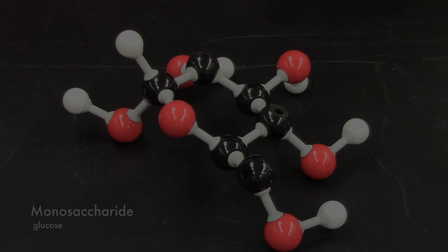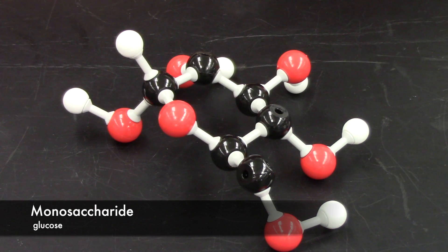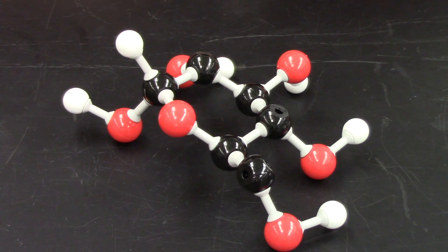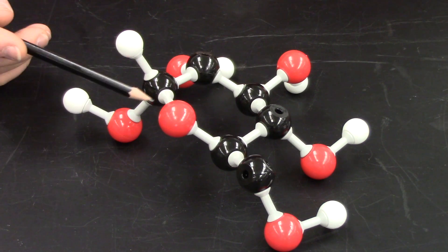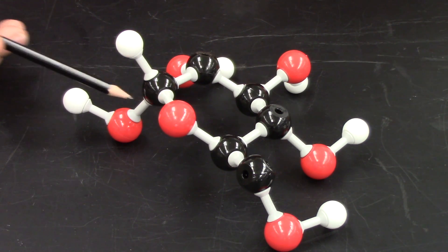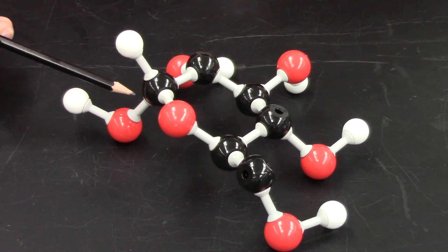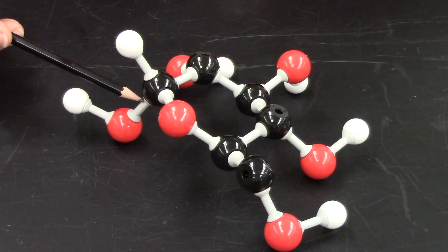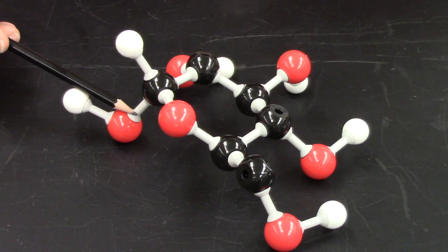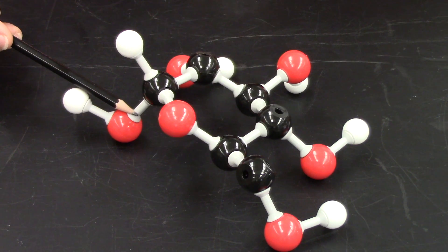In part two of today's lab, you'll be drawing the monosaccharide glucose in your notebook. Here is the model of glucose that you'll be examining. Here is the oxygen that is in the ring of the Haworth structure, and here is the anomeric carbon. The oxygen that is attached to the carbon is pointing in the downward direction. That makes this an alpha-glucose molecule.